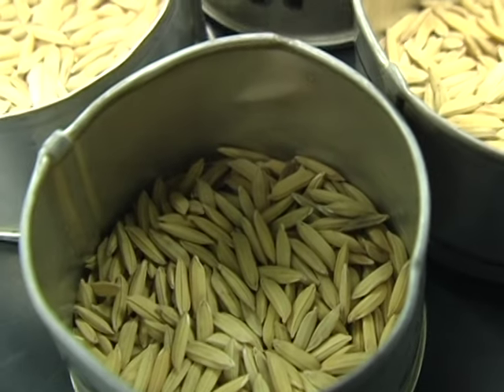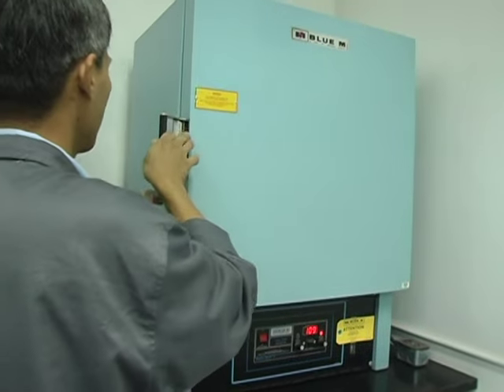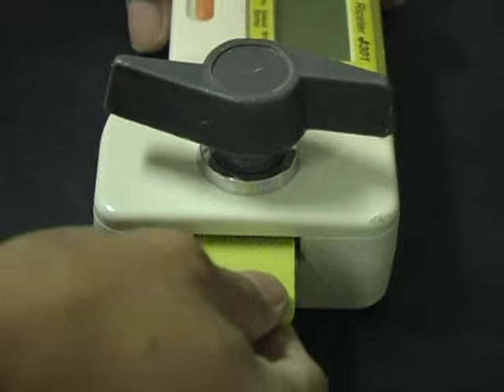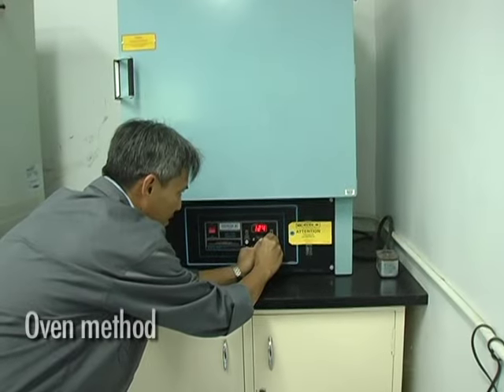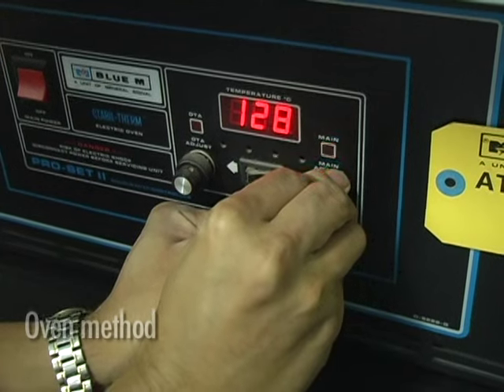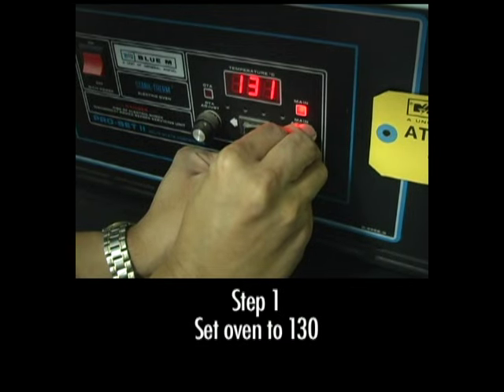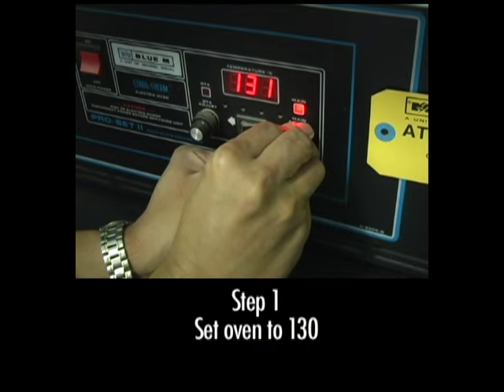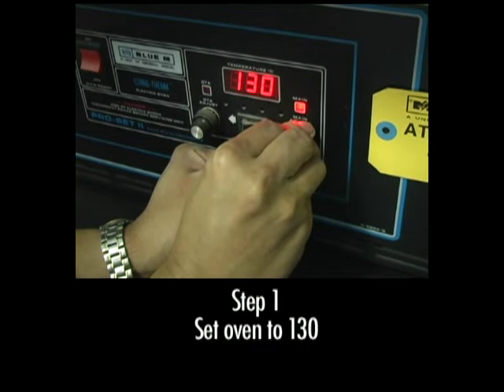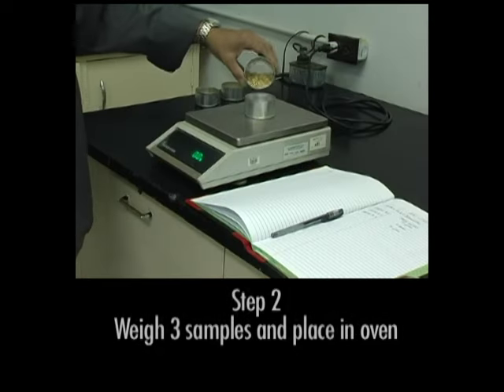There are two methods used to measure moisture content: the oven method and the moisture tester. To measure moisture content using the oven method, use a temperature-controlled oven. First, set the oven to 130 degrees centigrade. Make sure the temperature is not higher than specified because chemical changes will occur within the grain which can cause additional weight loss.